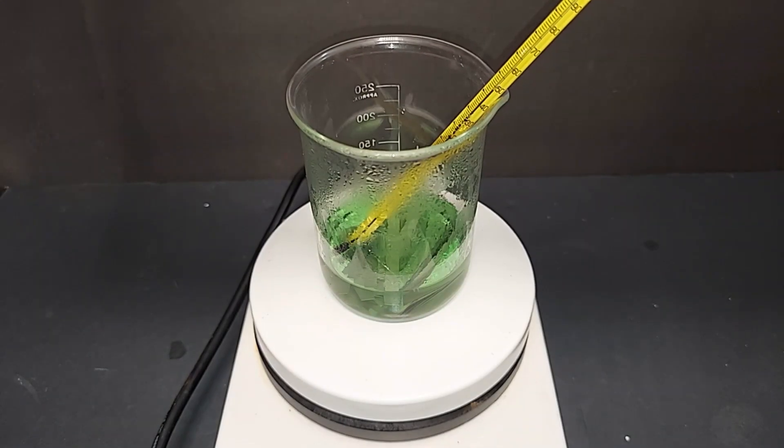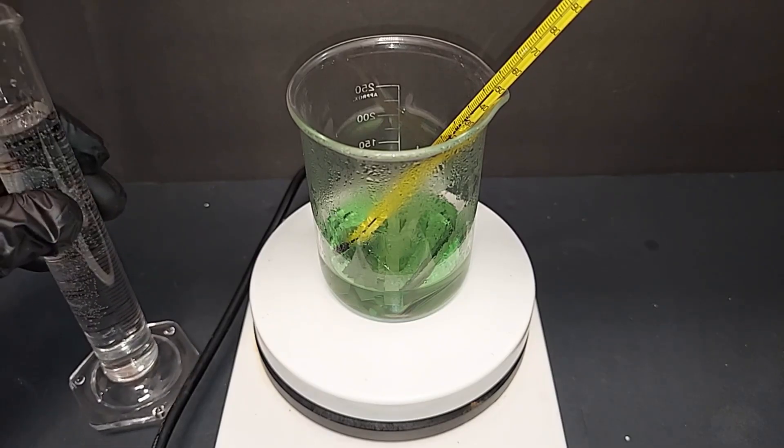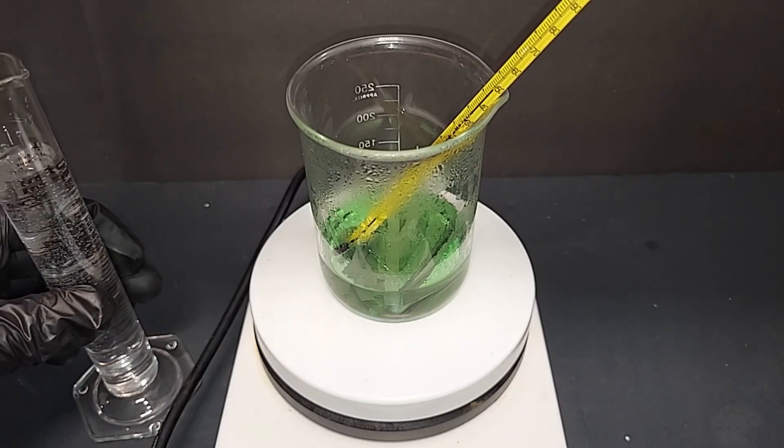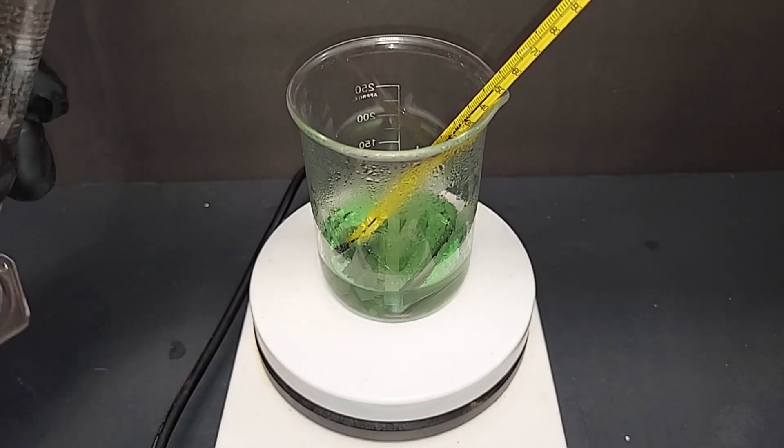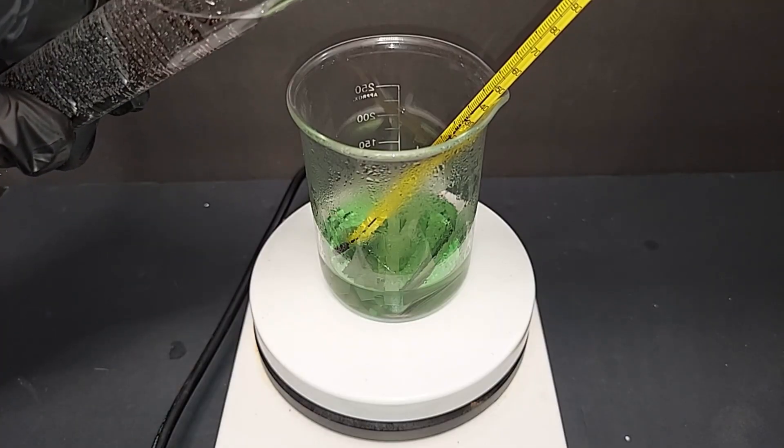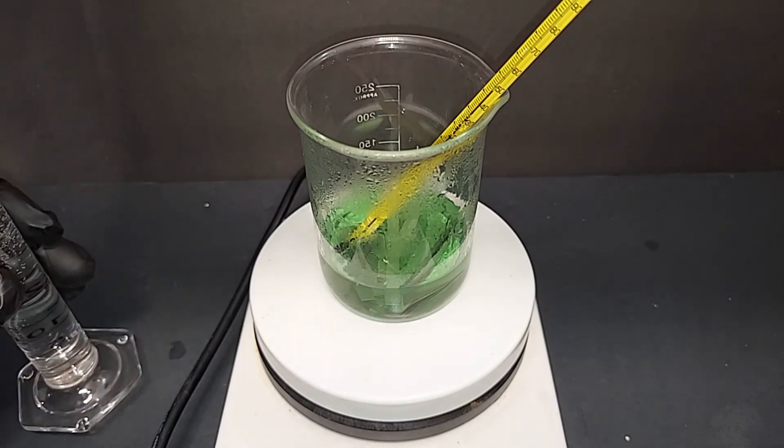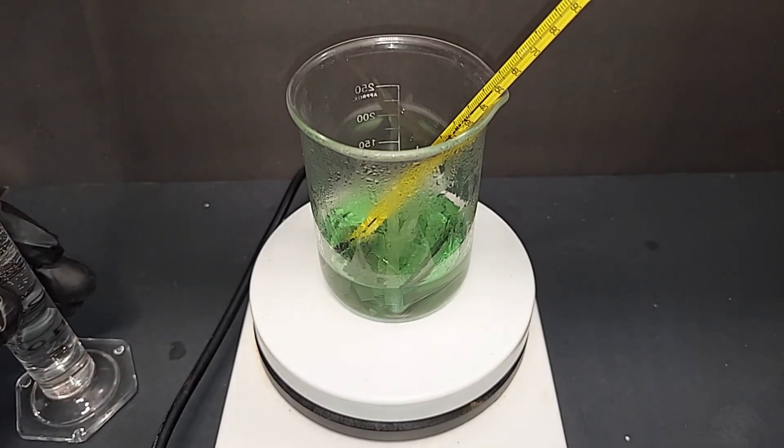It's been another half hour. You can see that the solution's turned a little bit more green with the 10%, but I'm now going to move on to 20% as that did very little. And if 20% doesn't work, I'll move up to 30%. I added approximately 15 milliliters of the 10%. The temperature is a little bit on the lower side at around 45 because this is an exothermic reaction and it will bump it up at least 10 degrees Celsius.